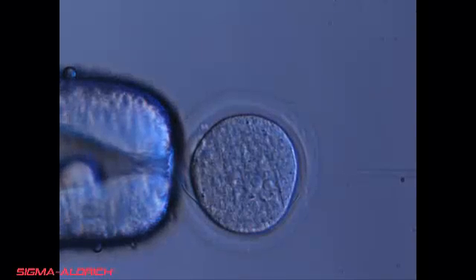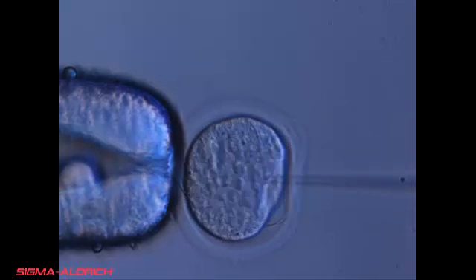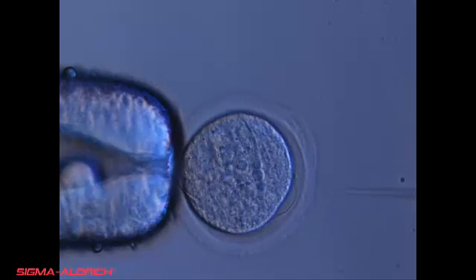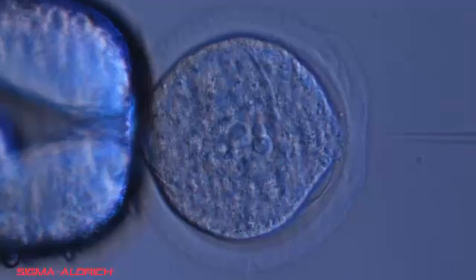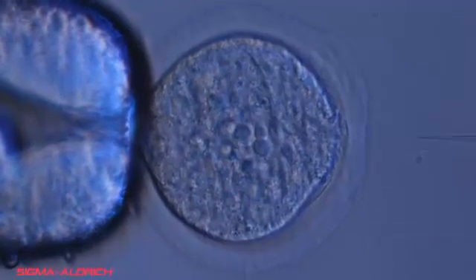In the next couple of examples, the injectionist will demonstrate situations that should be avoided. The microinjectionist purposely pierces the zona and vitelline membrane and moves the needle incorrectly, and also moves the injection needle in and out of the embryo multiple times. You can see the cytoplasm start to leak out into the zona space. This leakage will cause cell lysis and inevitably apoptosis to occur.